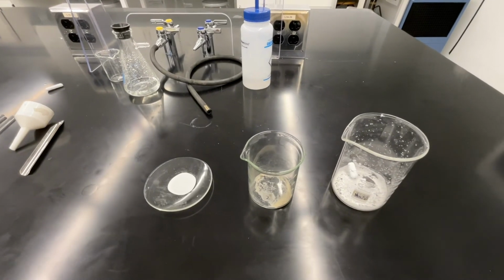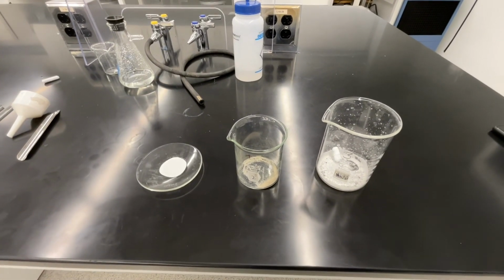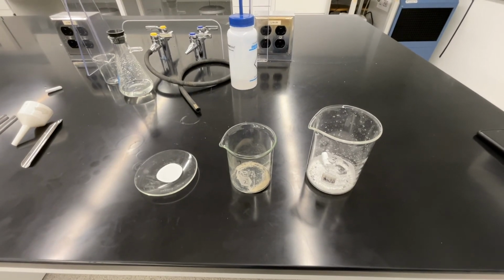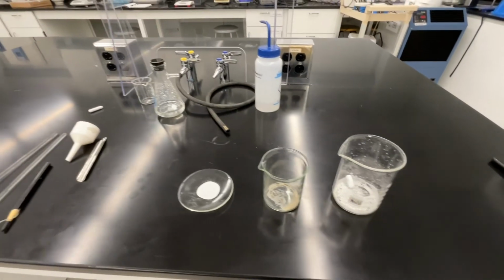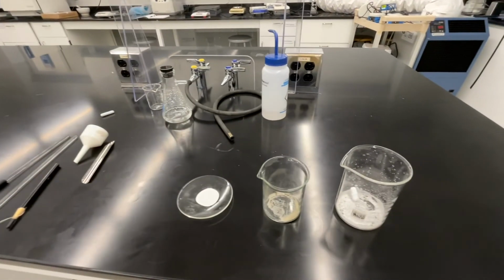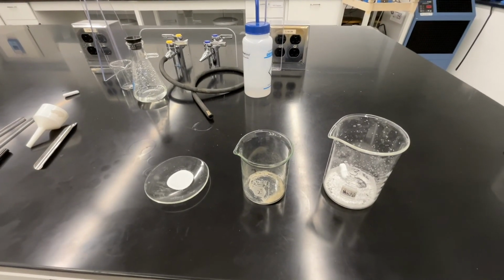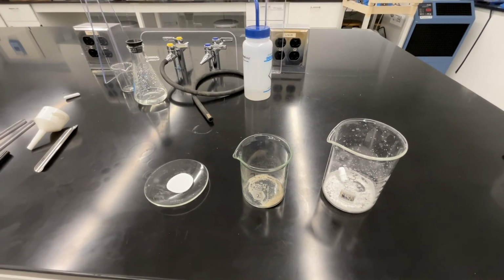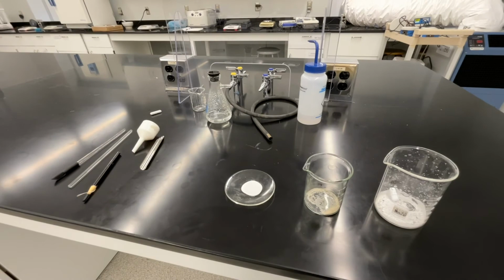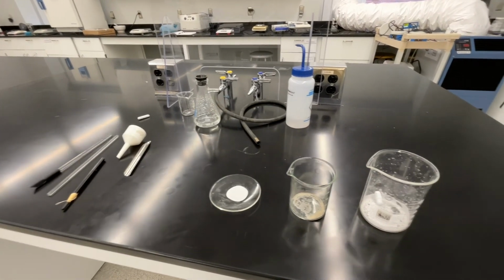Upon completing this experiment, you will have separated the 3 components of your solid mixture. Each component will be in one of these locations. Make sure that you understand which solid will be located in each piece of glassware. You'll notice throughout the experiment that we've generated quite a lot of glassware. It's important to thoroughly clean up your station before leaving lab and to properly dispose of all of your chemical waste.